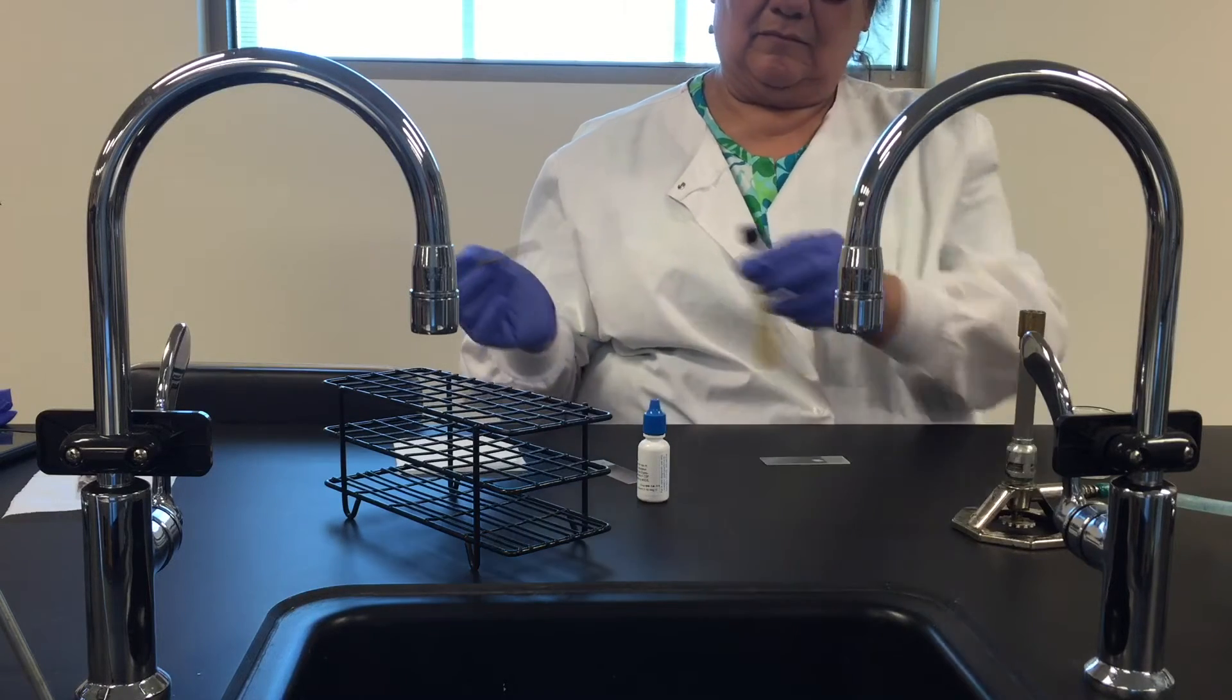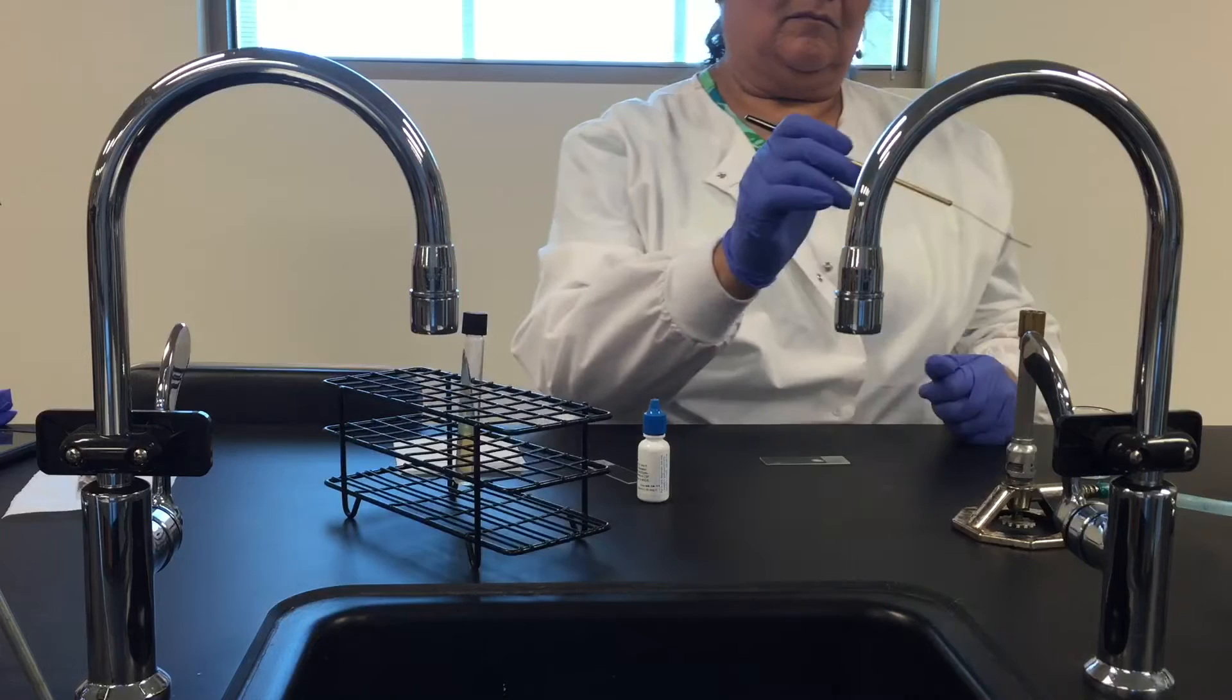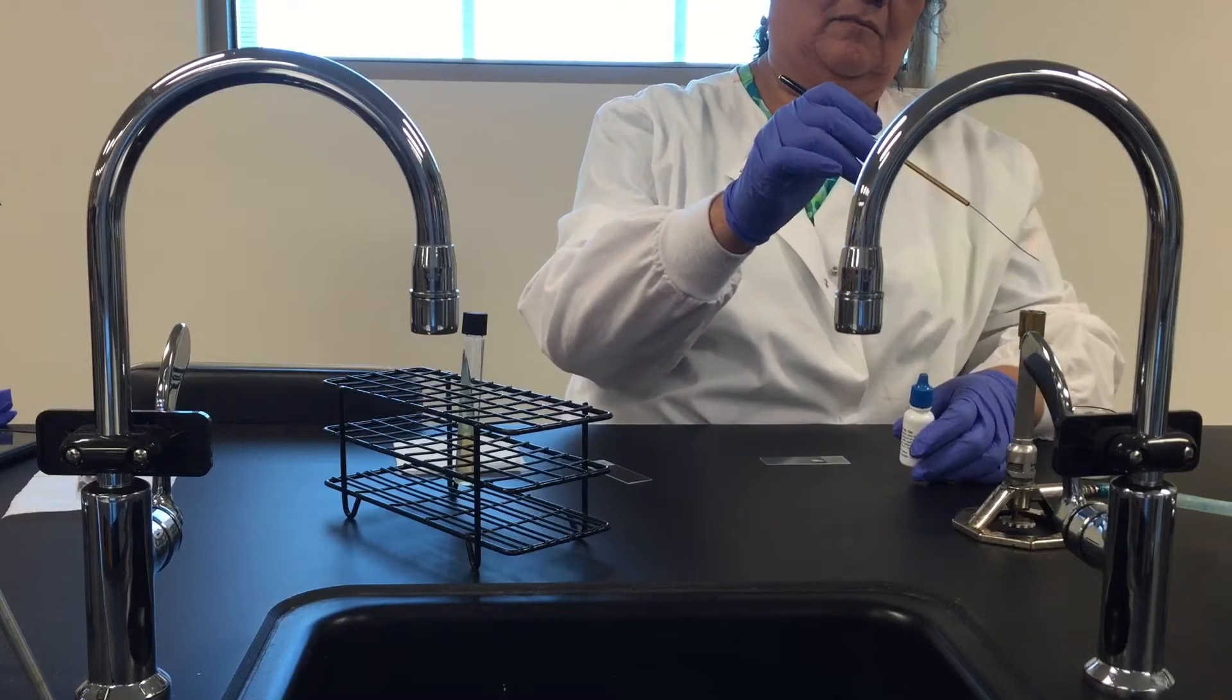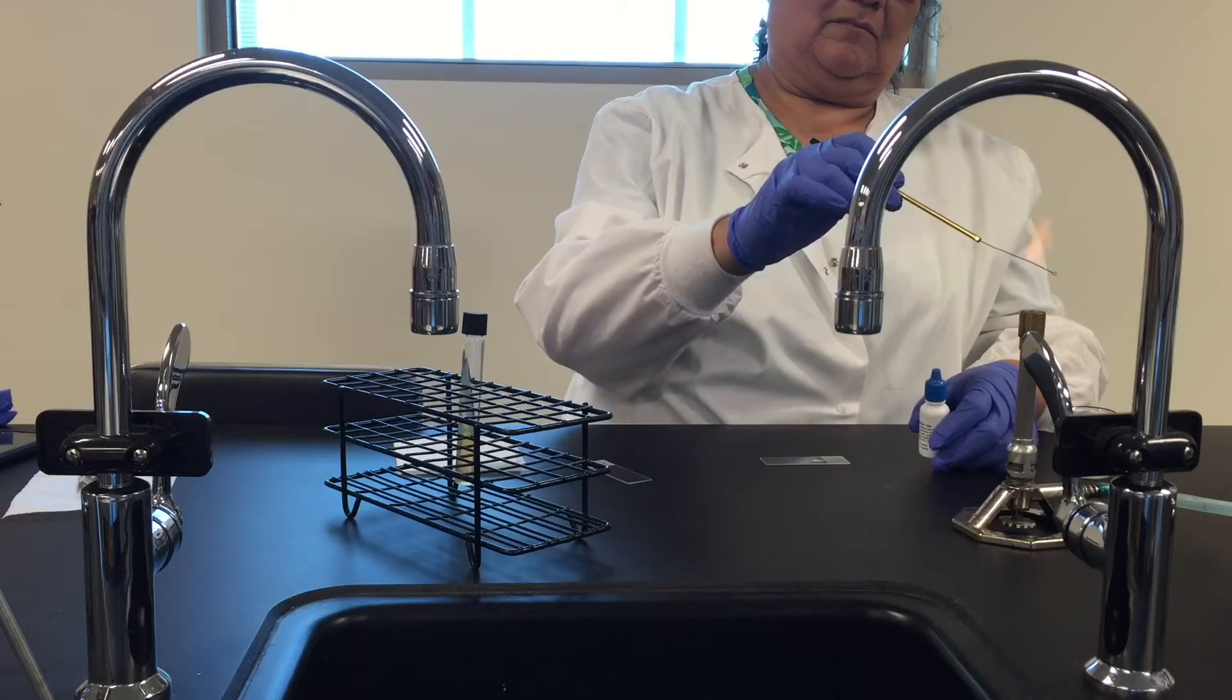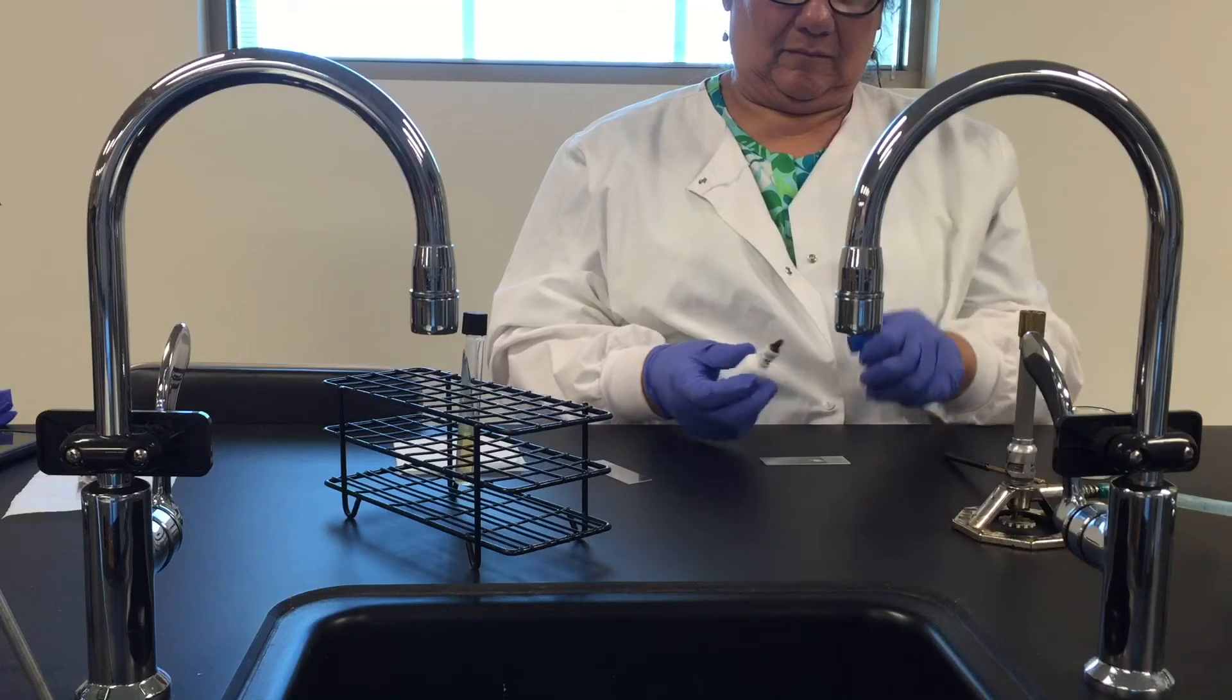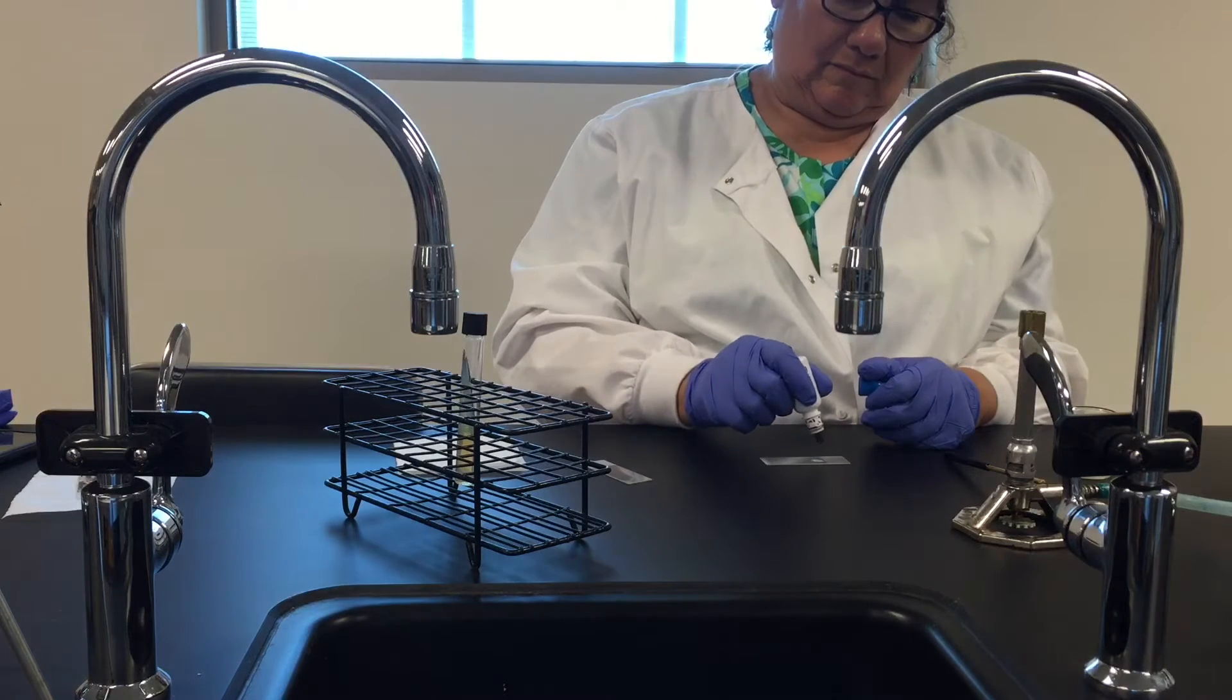After we do that, we're going to add one drop of India ink to the water and organism mixture. Please take care not to touch the tip of the bottle to the water or you're going to contaminate the entire bottle of India ink.